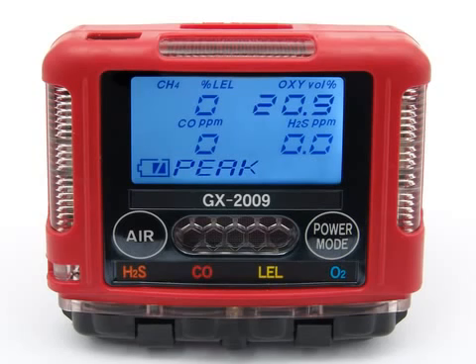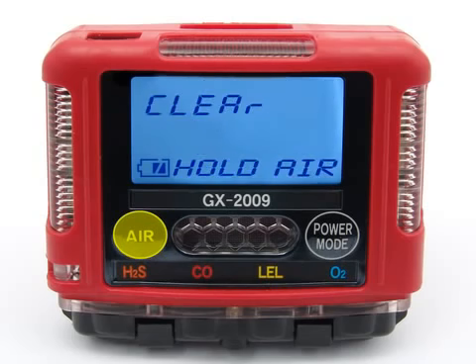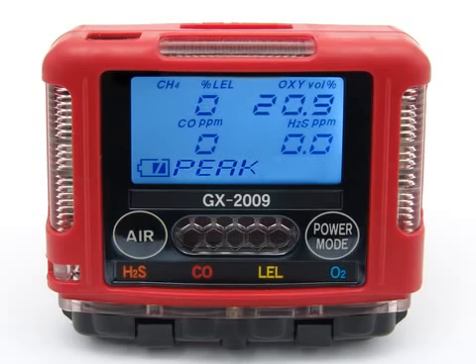If you want to clear the peak readings, press and hold the air button. After a couple of seconds, the LCD will prompt you to hold the air button. Hold the air button until the screen displays release. Press and release the power mode button again to proceed to the STEL screen.